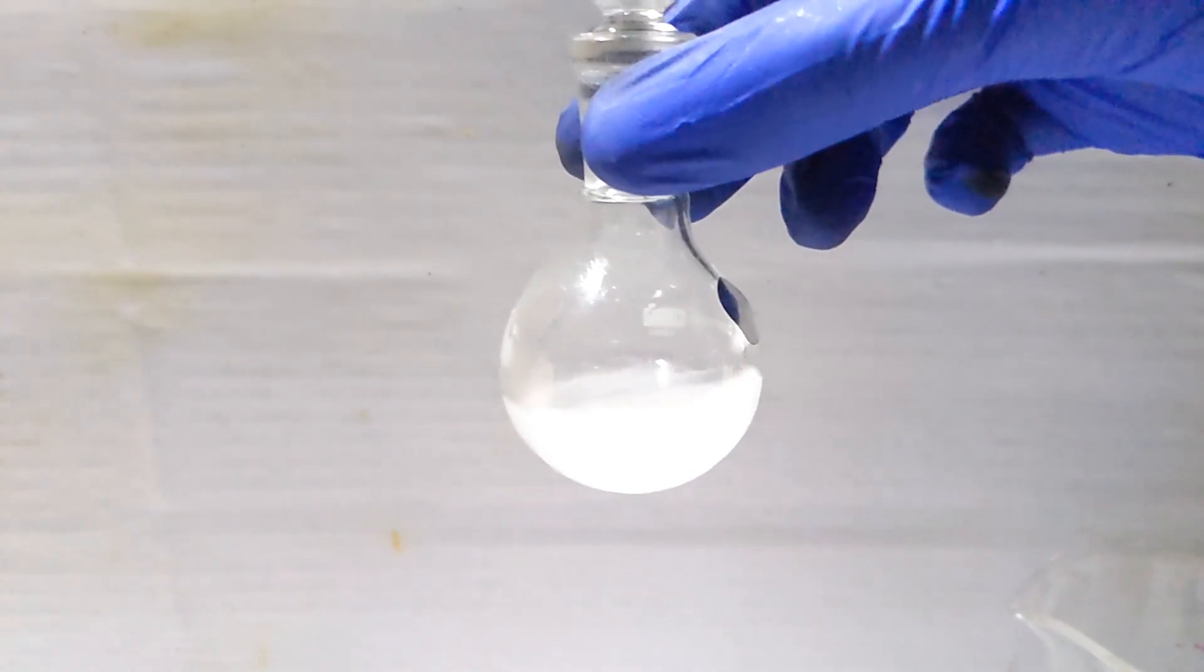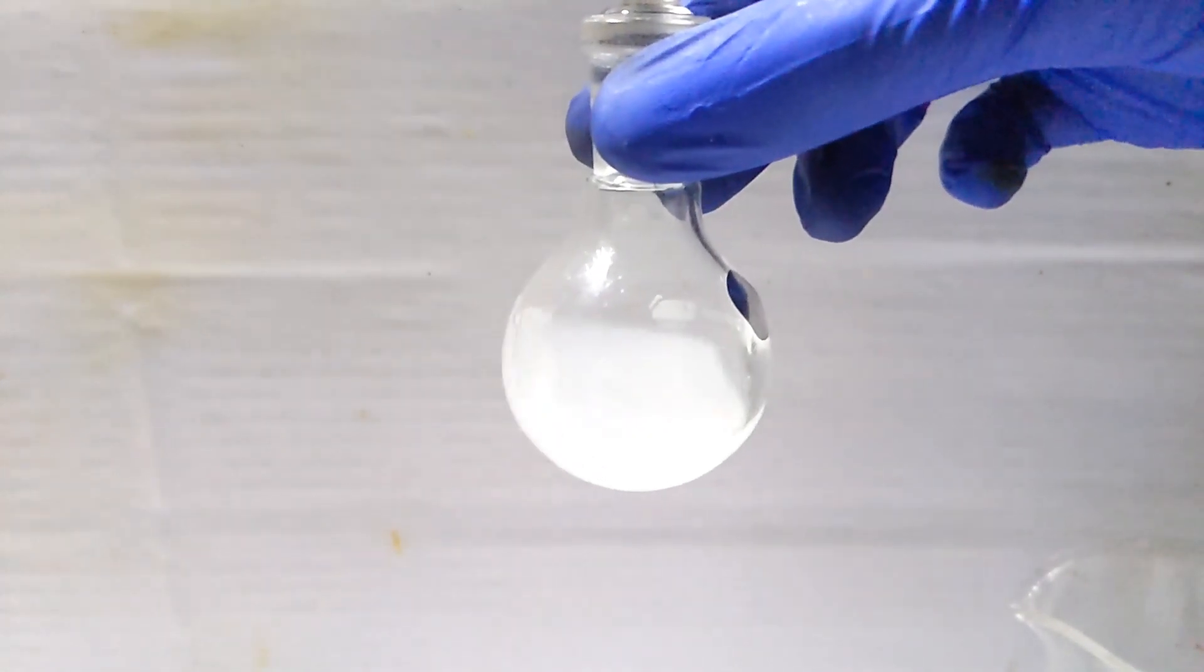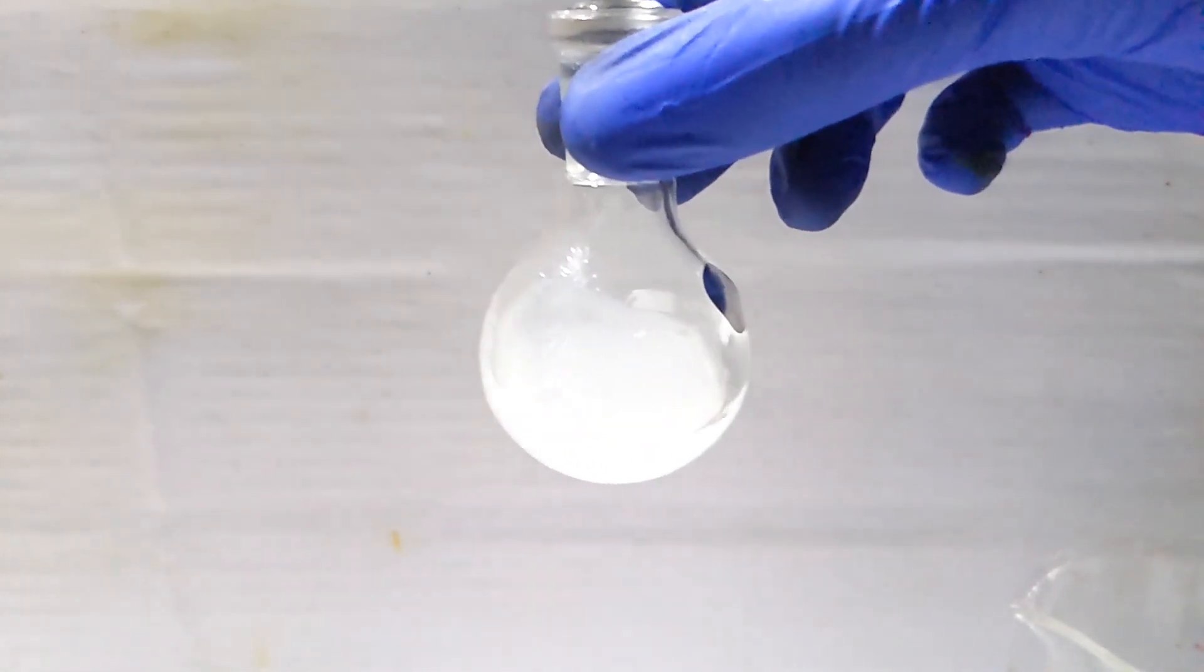You can see that the color of the solution is still turbid and this is due to the presence of water in it.